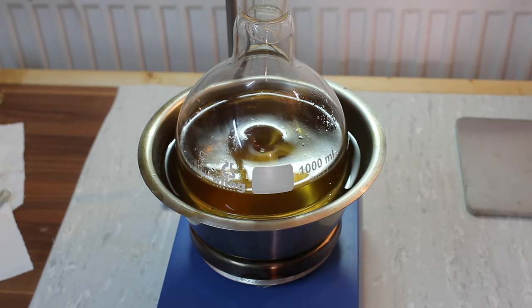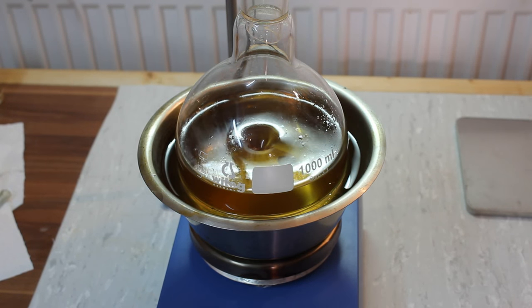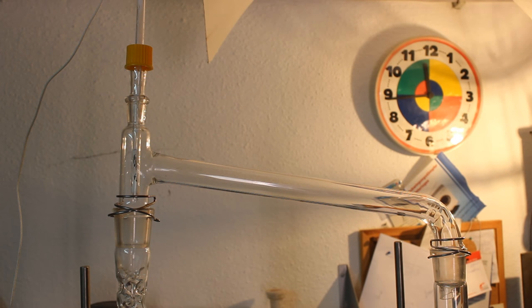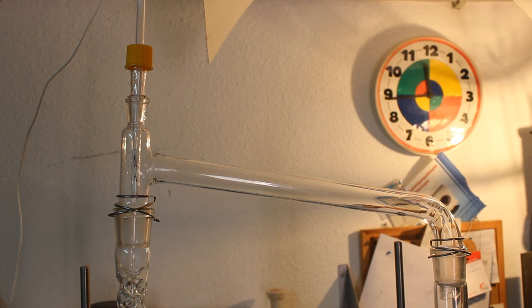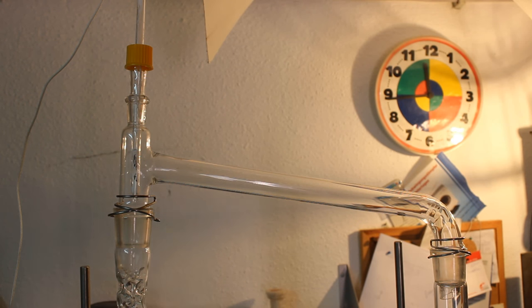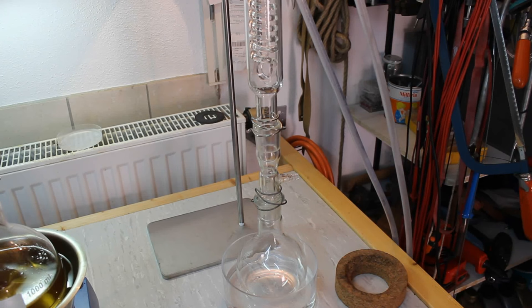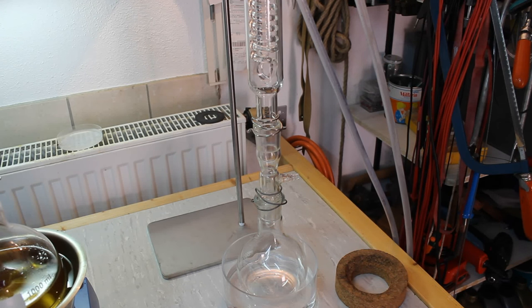I've set up for fractional distillation. I have my boiling flask sitting in an oil bath so we can distill off our product. The boiling flask is followed by a Vigreux column and a still head to which I have attached our digital thermometer probe we built in a previous video. Last but not least we have my Dimroth cooler which leads into our collection flask sitting in a water bath to which I will add some ice later on.